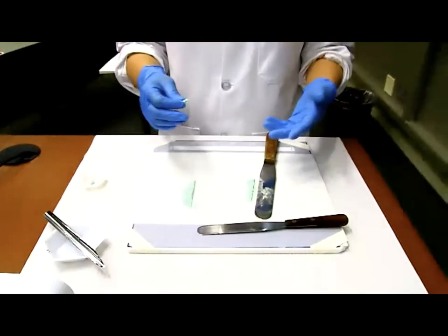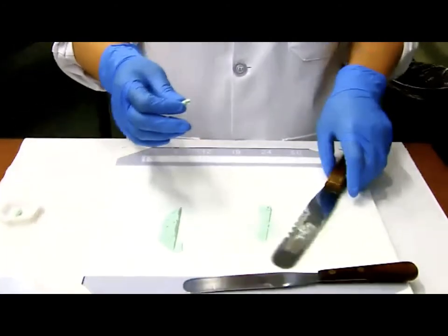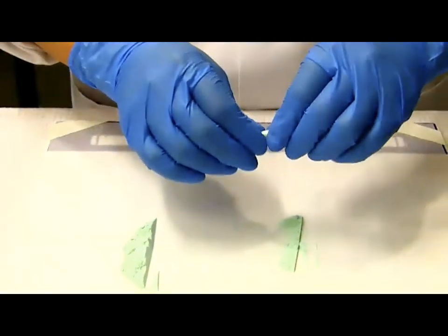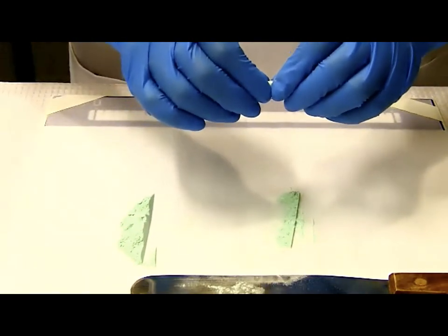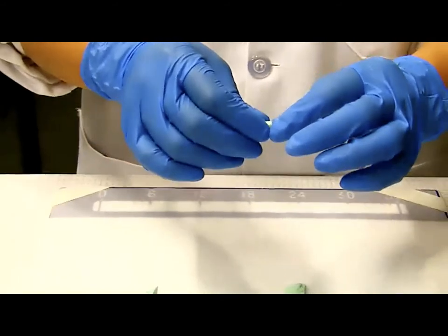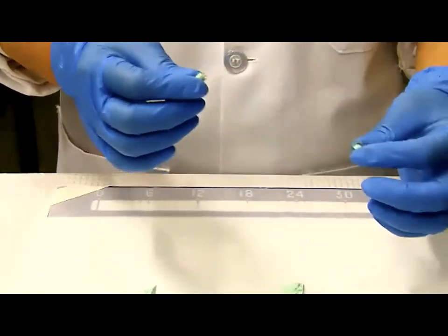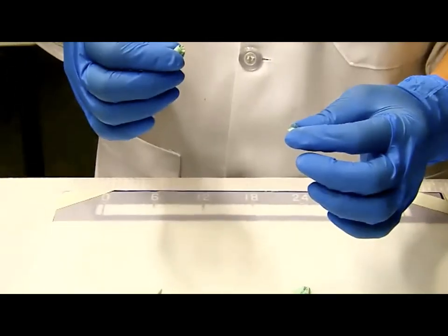If I'm using the same method, it's just not working because I'm not able to pack enough powder in. So here comes the third method. If you're really having trouble packing enough powder, in the lab, I think you guys are working with size 2. I'm working with size 3. Size 3 is a little harder to pack enough powder. You shouldn't have this problem. But if you're working with a smaller capsule that you have trouble packing enough powder, here comes the third method, which is the cheating method.